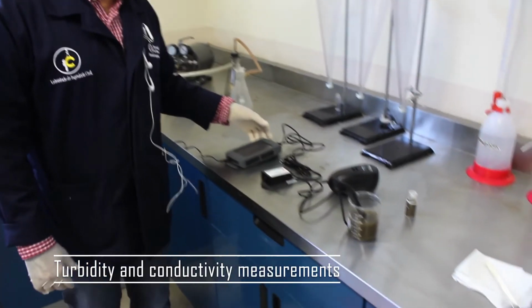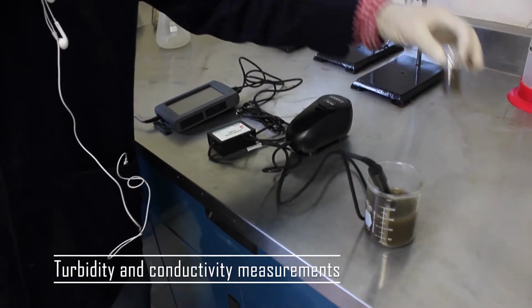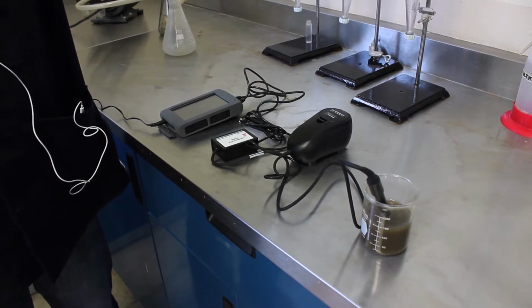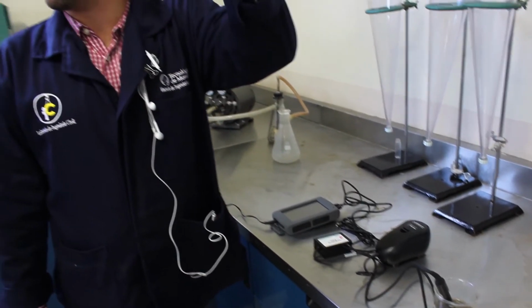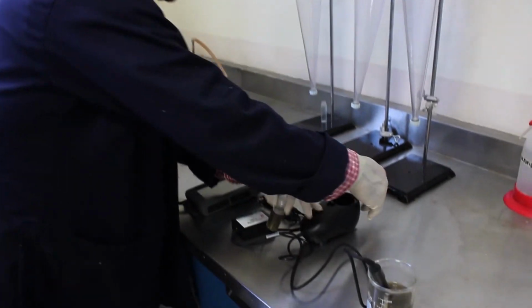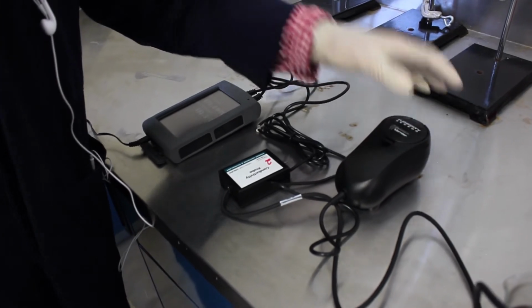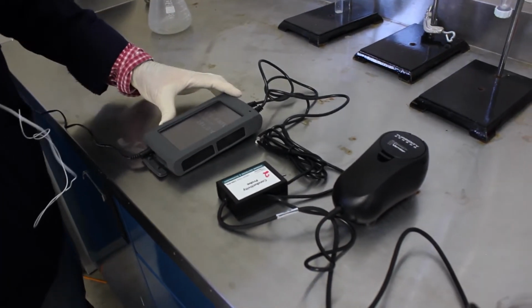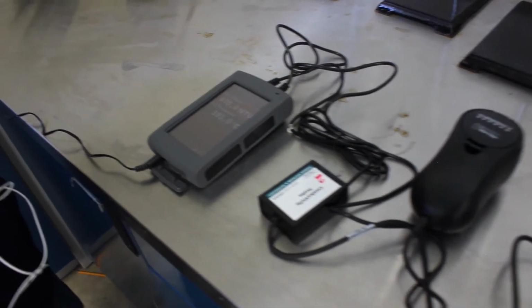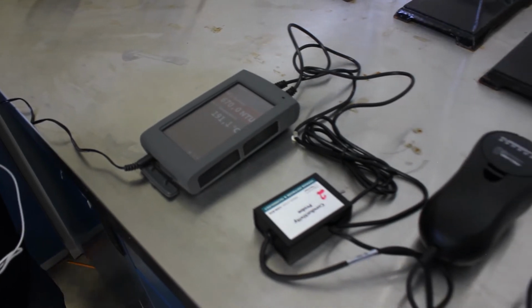So this time we're going to use these instruments for measuring turbidity and conductivity, okay? I put a 10 milliliter sample in this cuvette. So we're going to just put it in. It's the same principle of photometer, okay? It's going to use light to calculate. And it has an NTU of 670, okay? Turbidity, 670.